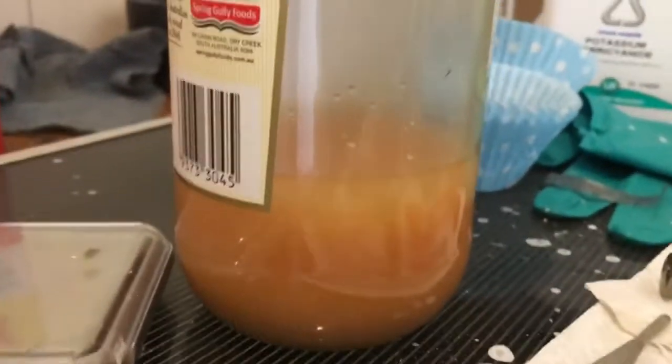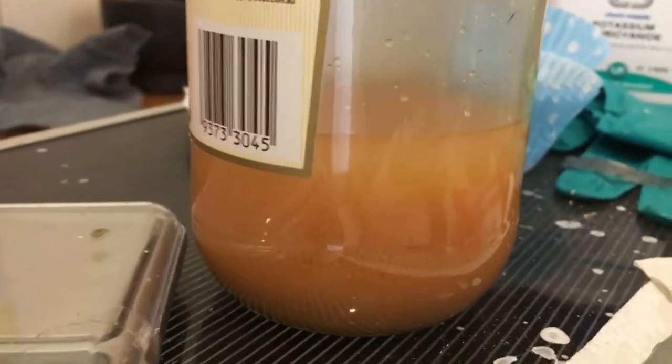First time through the filter. I've collected a bit. A lot of it's still in solution. So I'll redo it a couple of times just to collect as much as I can. And there's a fair bit in there by the looks of it compared to last time. I'll filter it again a couple of times.